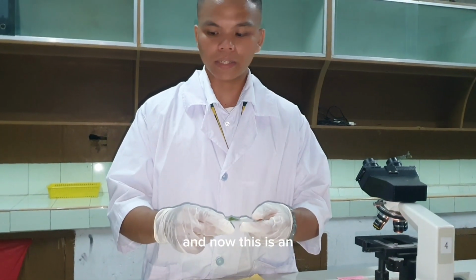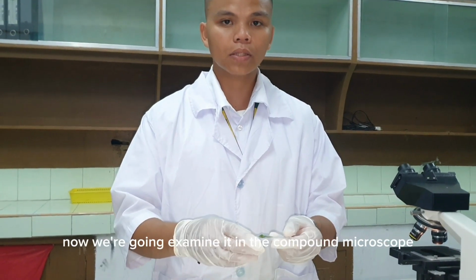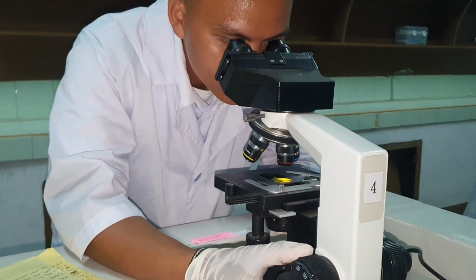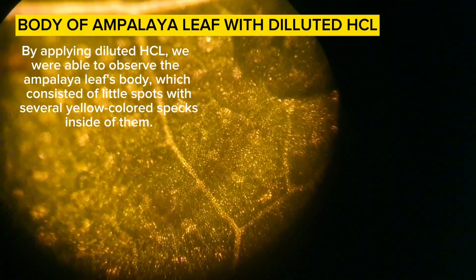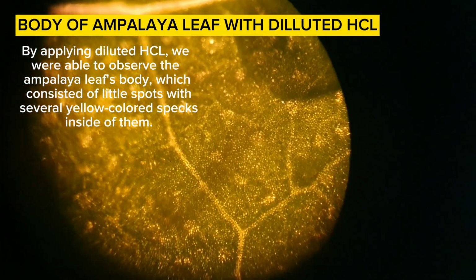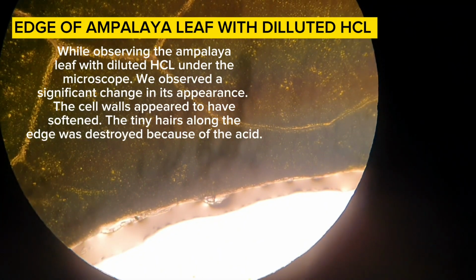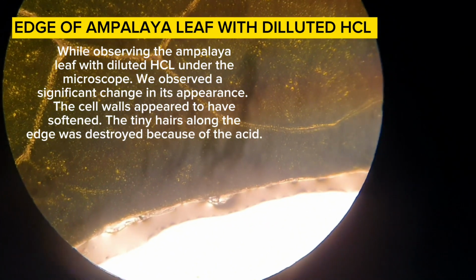And now this is an ampalaya leaf together with diluted HCl. Now we're going to examine it in the compound microscope. By applying diluted HCl, we were able to observe the ampalaya leaf's body, which consisted of little spots with several yellow-colored specks inside of them. While observing the ampalaya leaf with diluted HCl under the microscope, we observe a significant change in its appearance. The cell walls appeared to have softened. The tiny hairs along the edge were destroyed because of the acid.